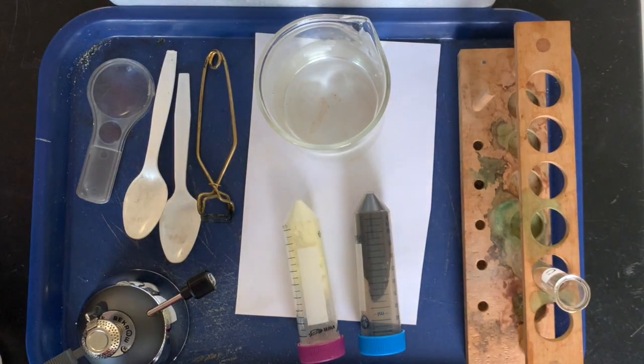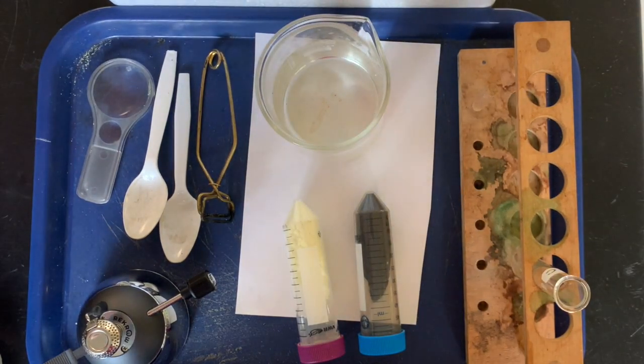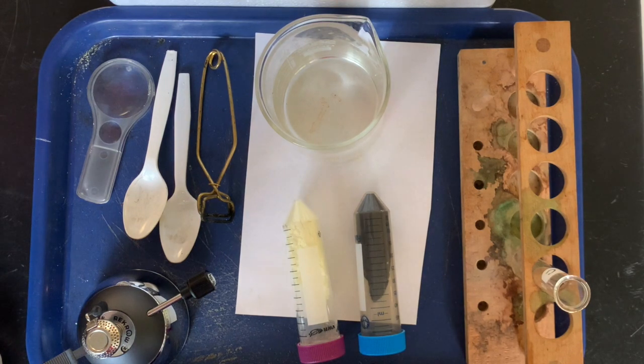What's up Mustangs, this is Miss Gaffney and Miss Hibbard and we are here today to do the iron sulfide lab with you. So first we're going to go over the different materials that we're using today.